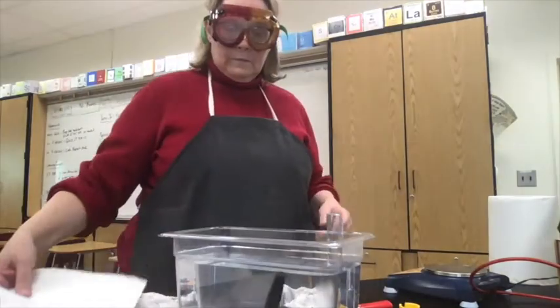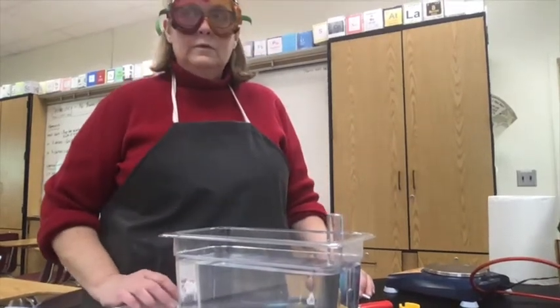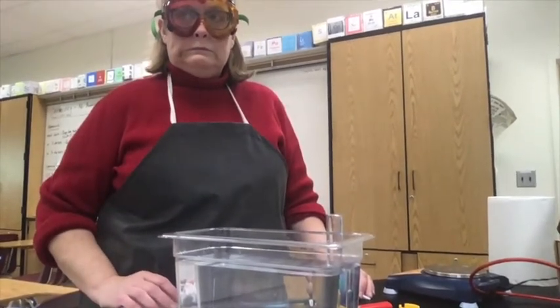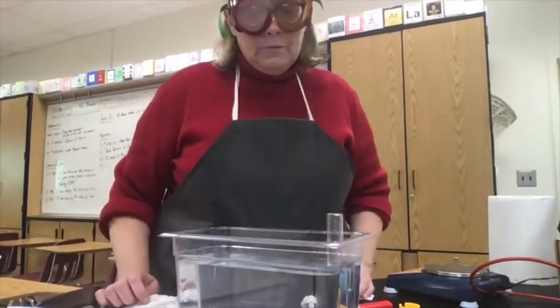All right, so now we're going to do trials 2 and 3 with you, but this time we're going to make you write down the measurements. We're not going to be writing them down on the data table for you. So hopefully you'll be able to see this. We might call out the volume for you.